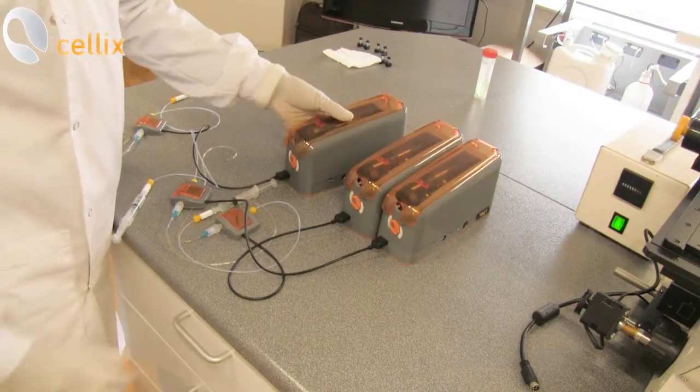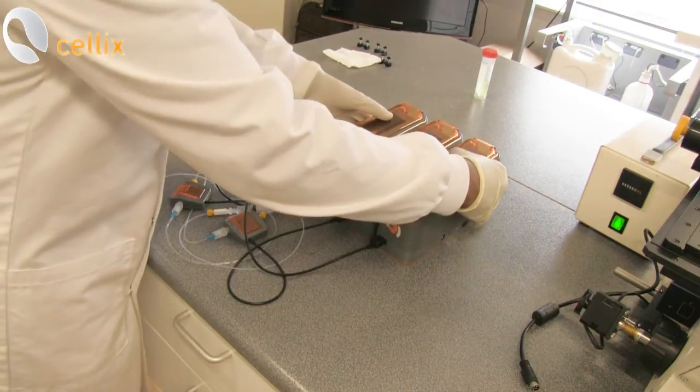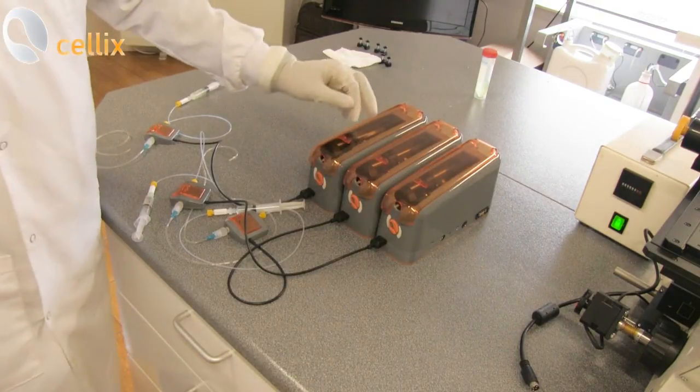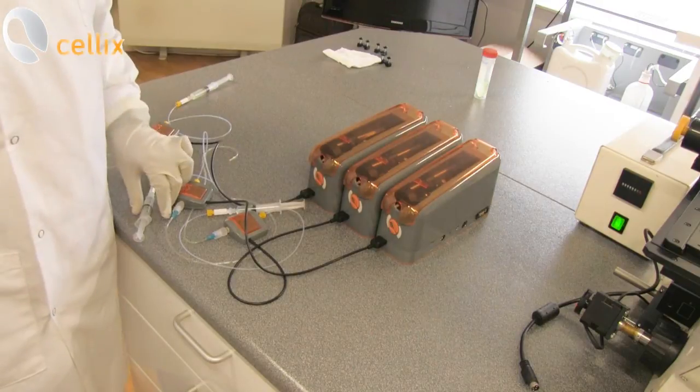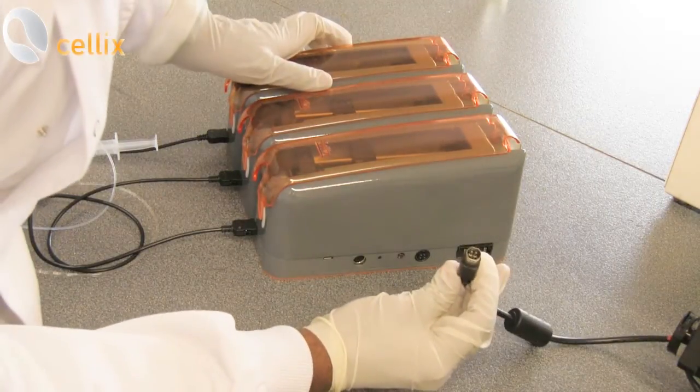Similarly, connect the third pump to the second one. You can connect these pumps even before pre-filling the syringe. I'm going to connect the power supply. This is a power supply lead.